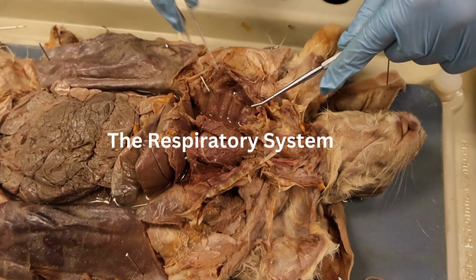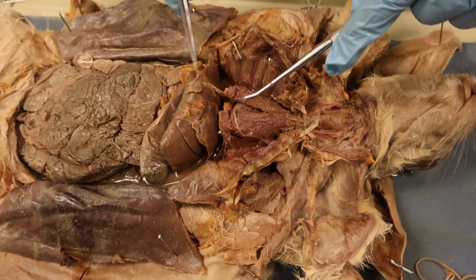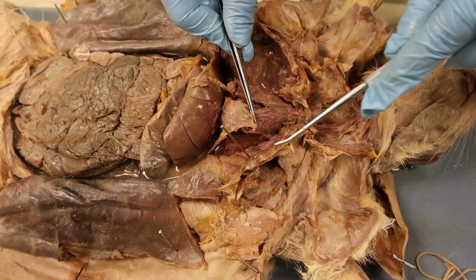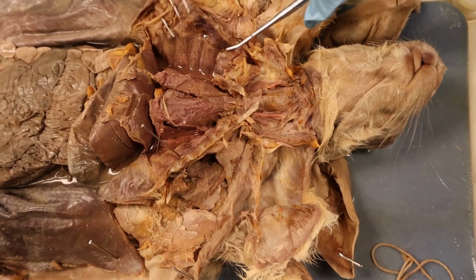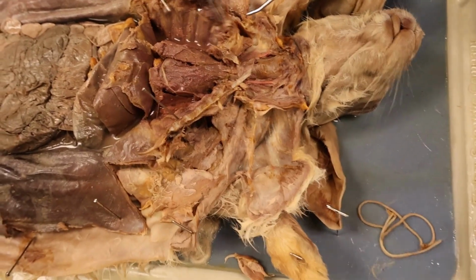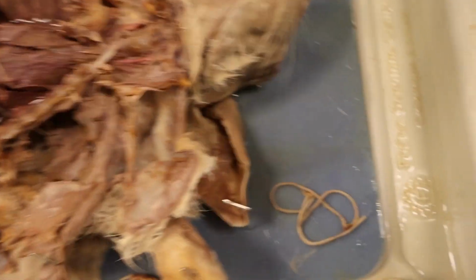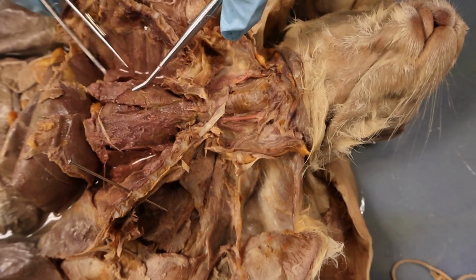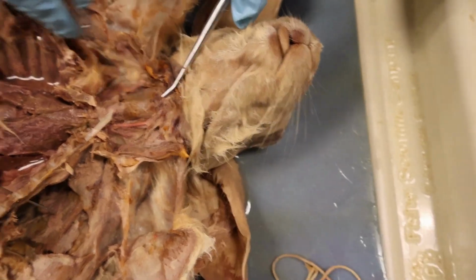So this is going to be the respiratory system. We have the diaphragm, the thin muscle that controls breathing in mammals. Right next to it is the rib cage, which is part of the skeletal system. This protects the lungs and the heart in mammals. Right underneath it, shown here, are the lungs. And then we have the trachea right over here.